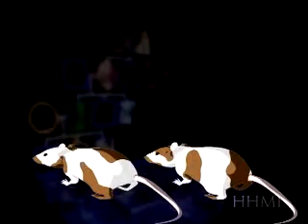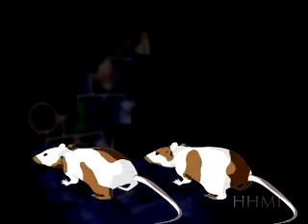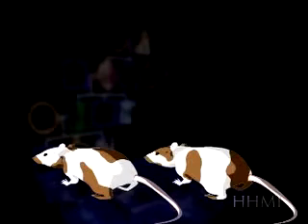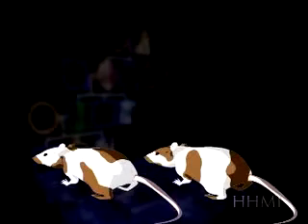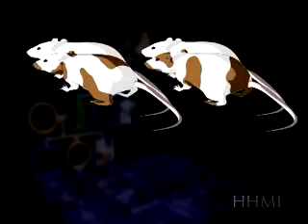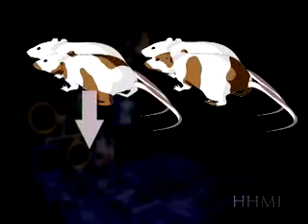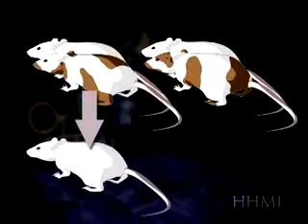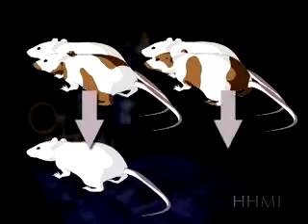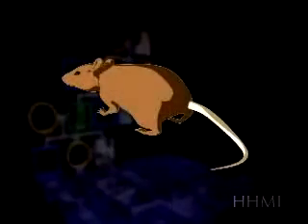To establish a line of mice with a new transgene, it is necessary to find chimeras whose germline cells — that is, sperm or egg cells — have developed from the injected ES cells. This is done by breeding the chimeras with albino mice. In some chimeras, the germline cells are not from the ES cells and the offspring will be albino. In others, the germline cells are from the ES cells and the offspring will be brown. These mice can be used to found the colony.